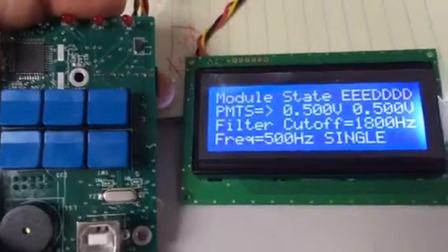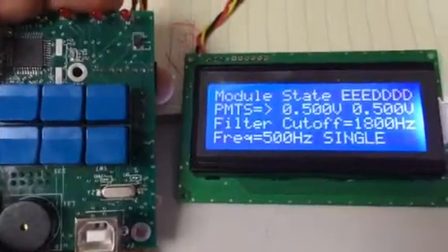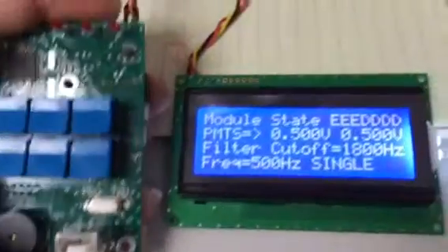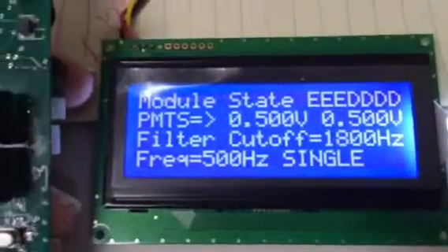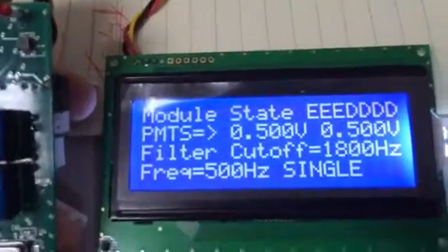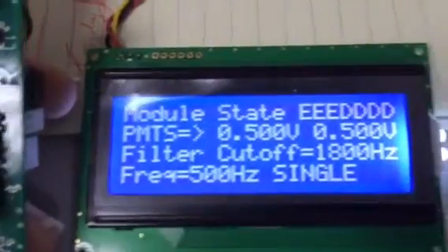Okay, this is documentation of a new feature for the biofluorometer software. This is going to be version 2.5. This enhancement pertains to the setting of the maximum current allowable for a LED module.